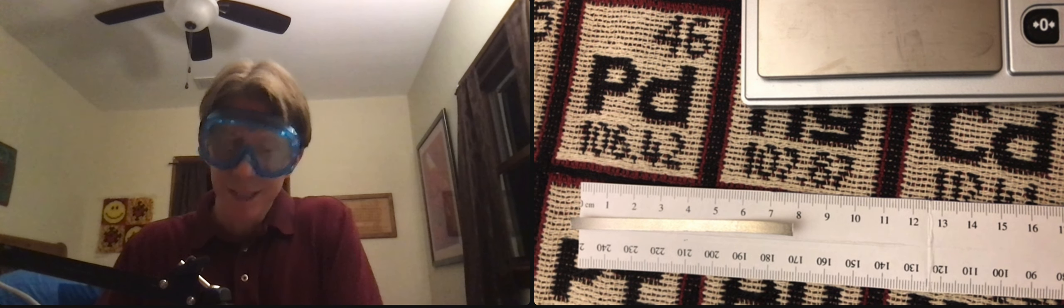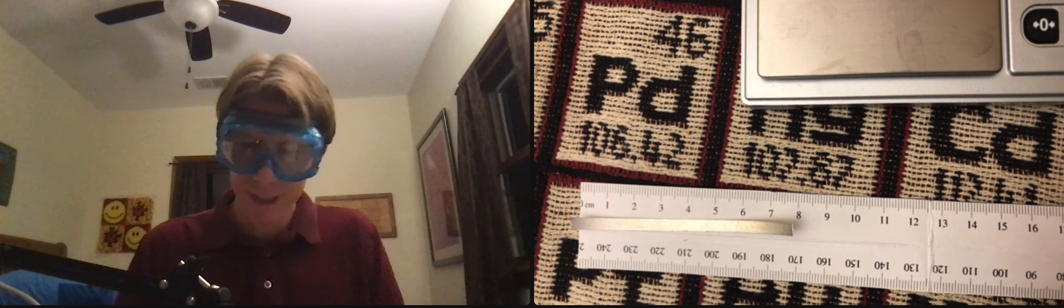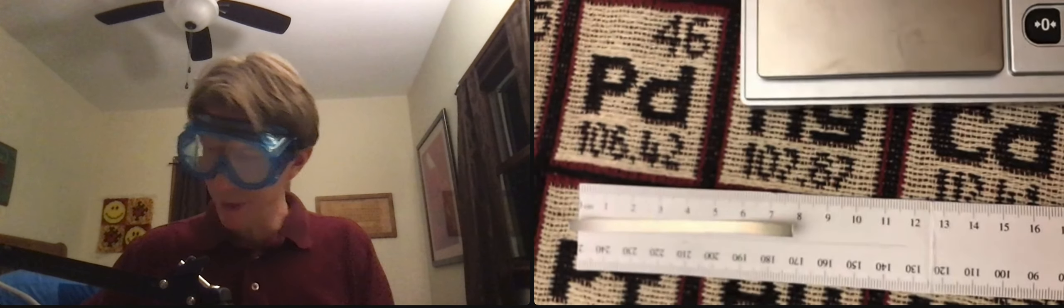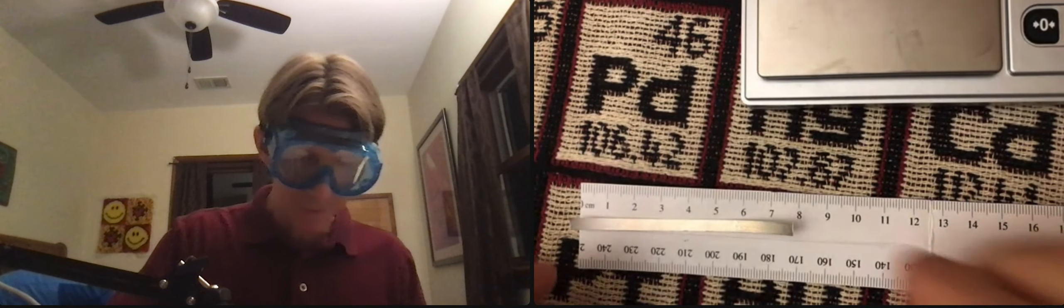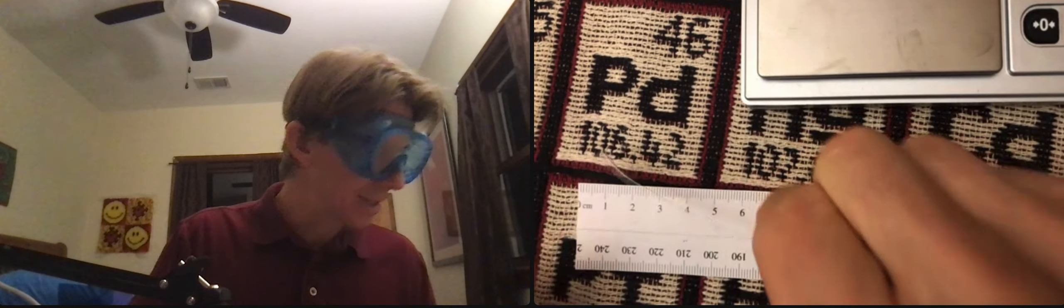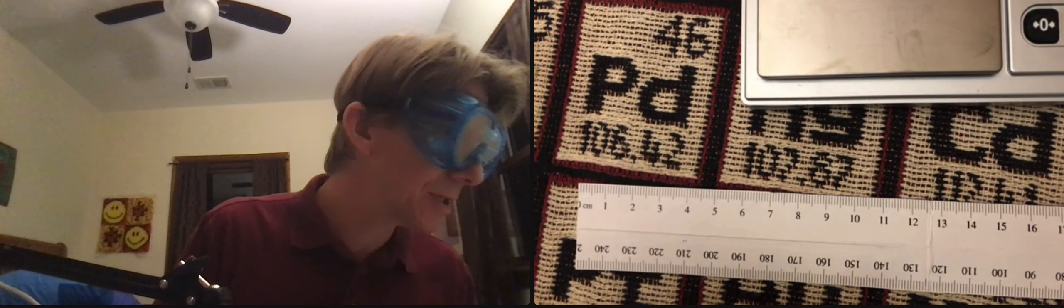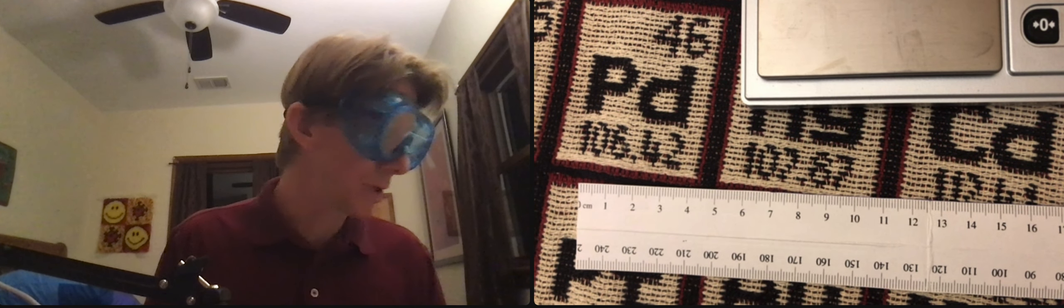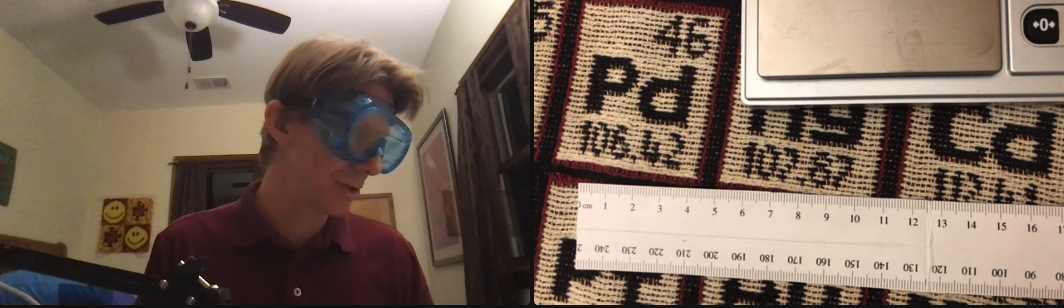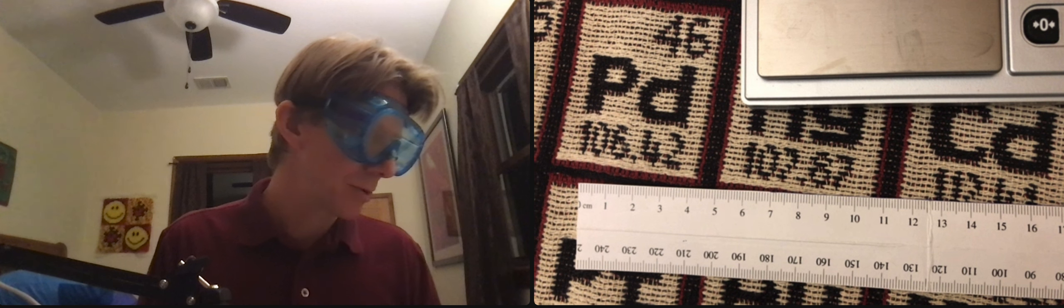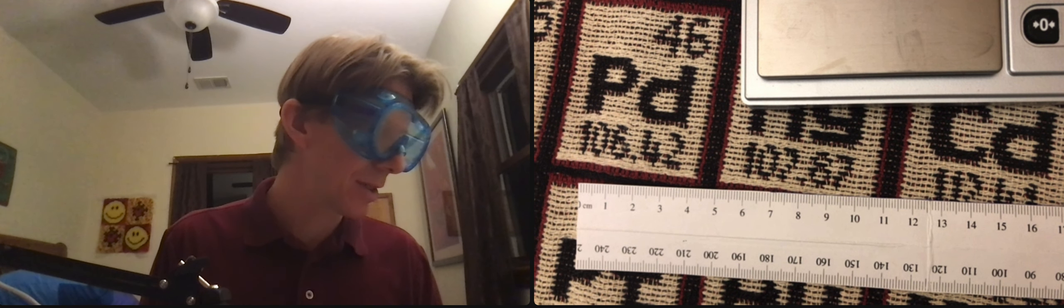And it says it right here on the table, but I'm going to write it anyway. Okay, so centimeters, and then you're going to, yes, use to the nearest 0.01 centimeters, good. Record the length.